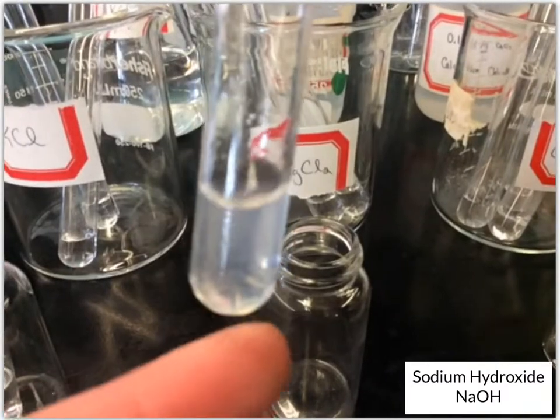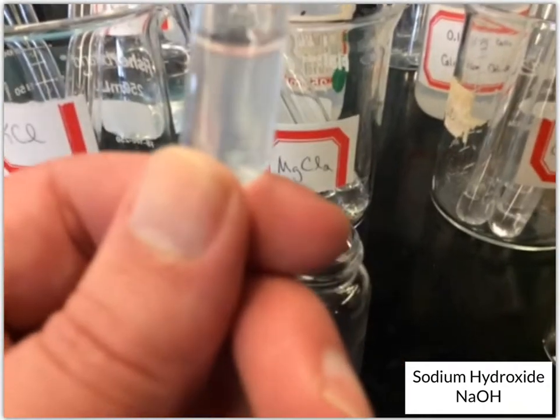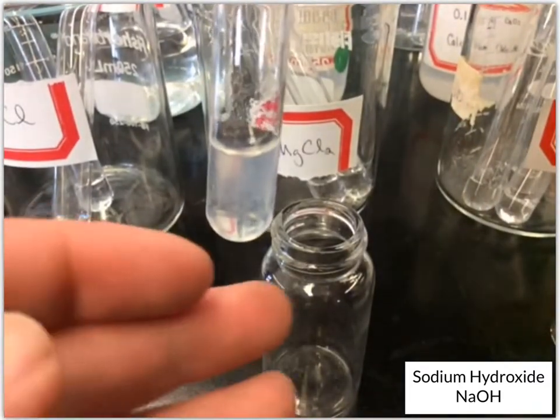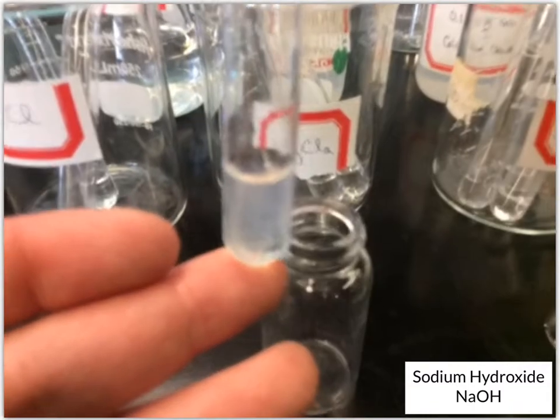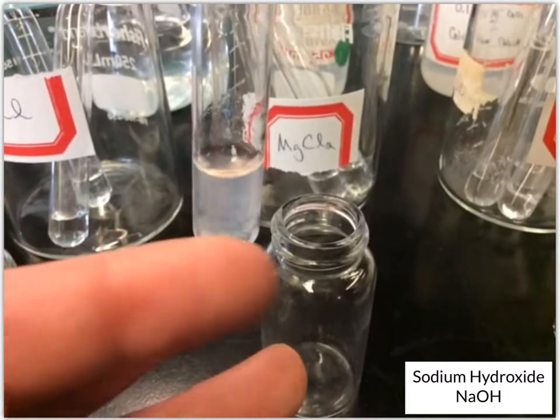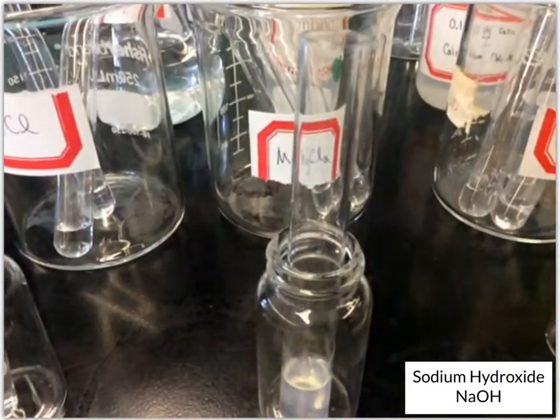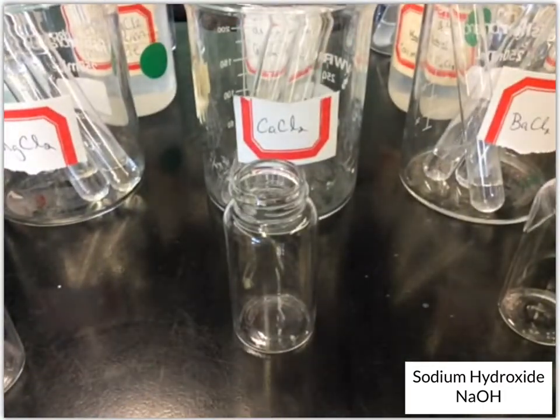See, it looks like we've got a little bit of a change here. And so it's a little bit cloudy. And maybe I can get it to focus a bit better. It actually is a little bit of solid floating in there. It's not a lot, but that's what that cloudiness is, and it kind of looks like it's trapped up in there, that it's not even going to sink. But we'll let it sit. We'll come back to it when we're done with all the tests. But we definitely have a change. We have some cloudiness.